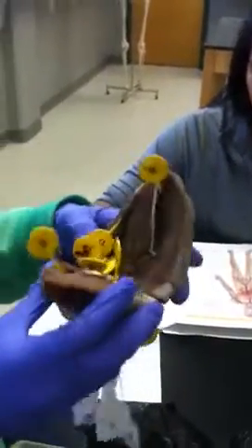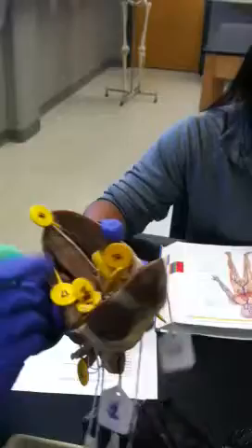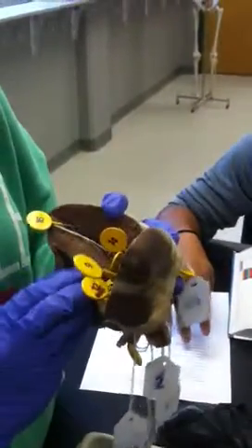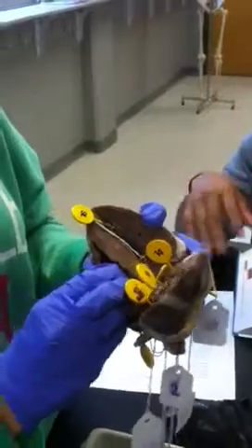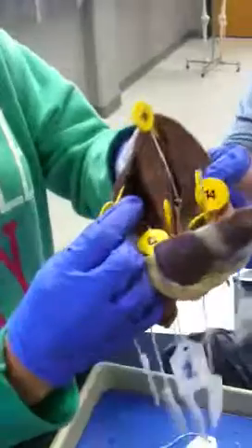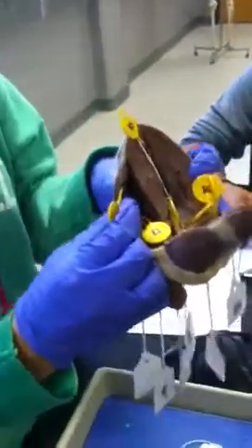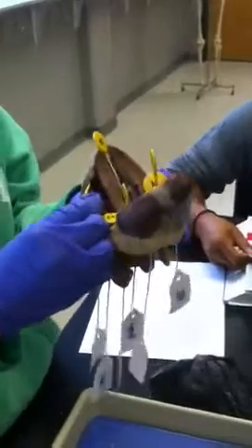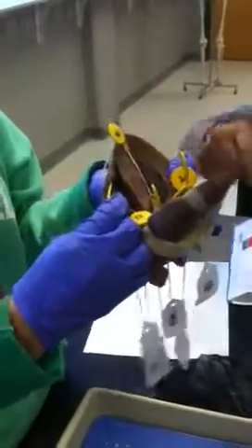And then 17, the last one, is the pectinate muscles, which is just bundles of muscle tissue. They say it looks like the teeth of a comb. It's on the side of the heart, right here, but I don't know if you can really see it in the heart. It's on the inside, on the lining of it.